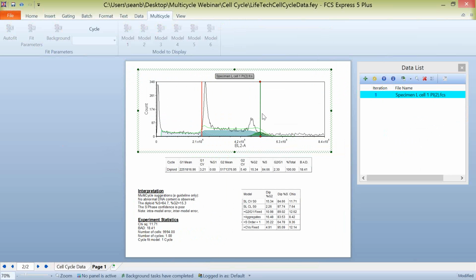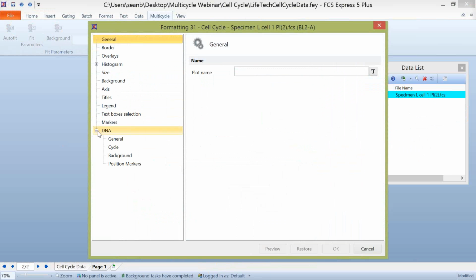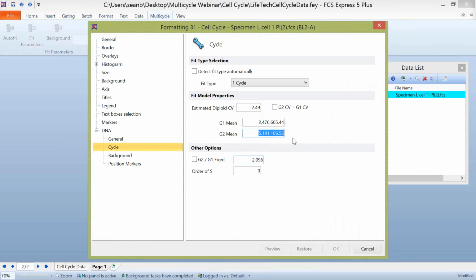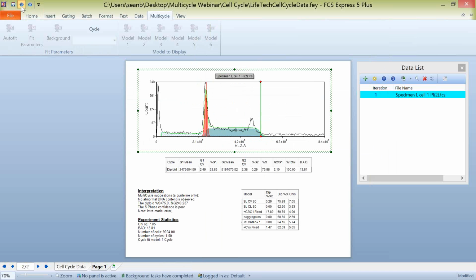And multi-cycle, when you make these changes, is going to try and recalculate the model based on where you had placed these position markers. And when it makes those changes, when we come into that formatting tab, you'll notice here that in our cycle, it did actually make that change there. So instead of about 2.4 million to 4.8 million for G1 and G2 means, you can now see our G2 mean is set up around 5.2 million. So again, this is a quick and easy way that you can come in if you're working with a batch process with data and you're noticing that some of your G1 or G2 means are shifting around a little bit for one reason or another. You can make a quick adjustment on the fly by adjusting these markers on the data.